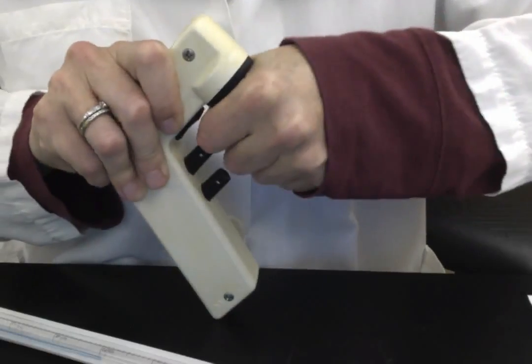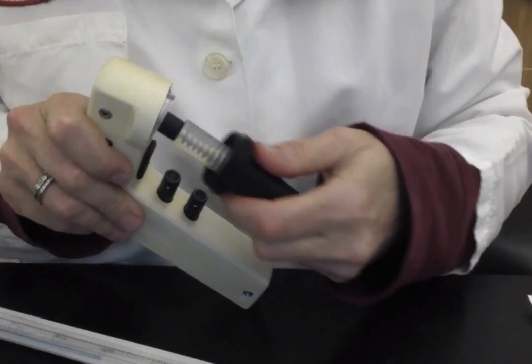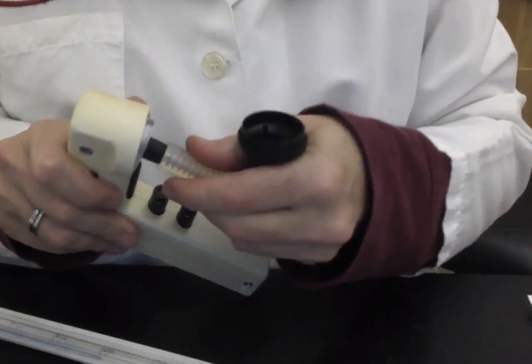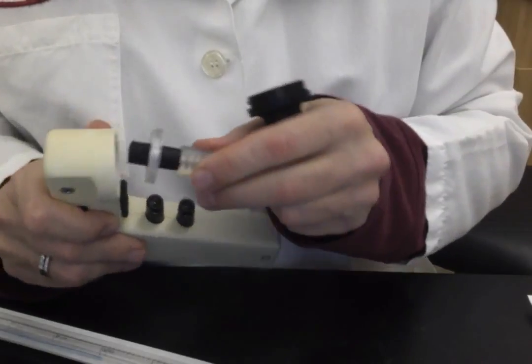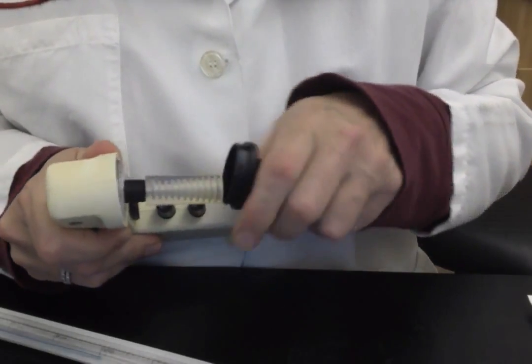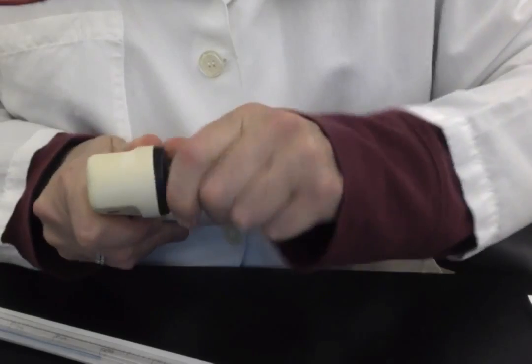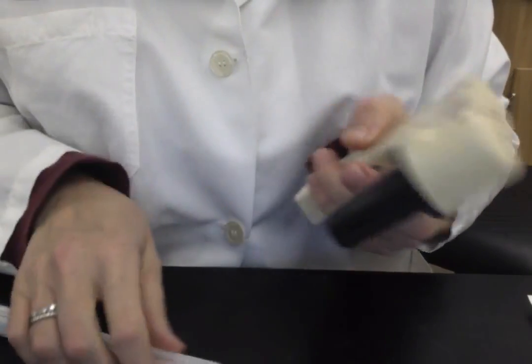You never want to bring fluid so far that it gets into this casing which houses a filter. If that filter is contaminated, then your samples that you're pipetting are no longer going to be sterile.